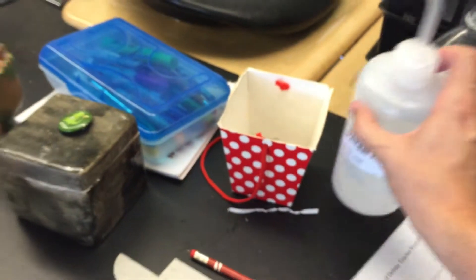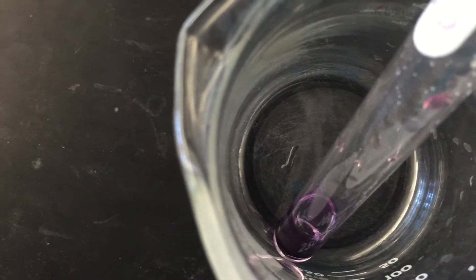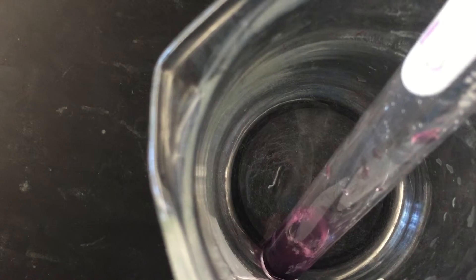I have some distilled water here. I'm going to add some distilled water to this. Now take a look and see what happens to our complex.